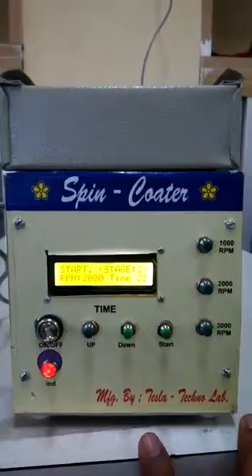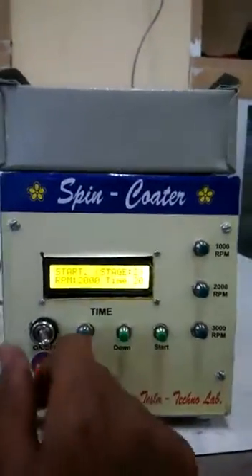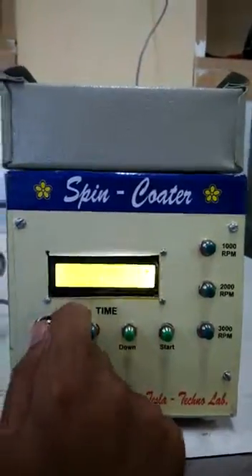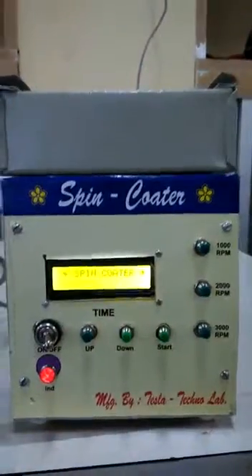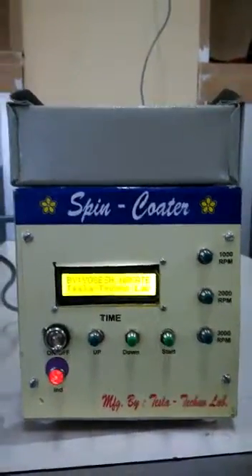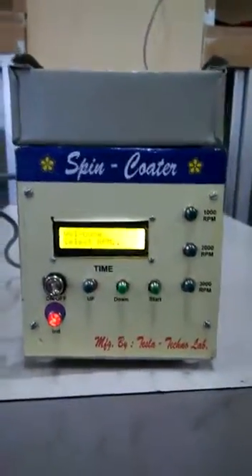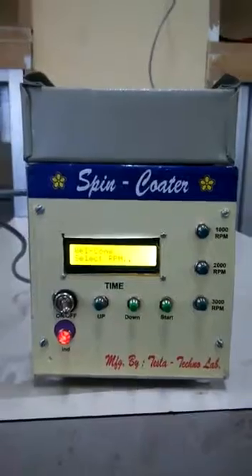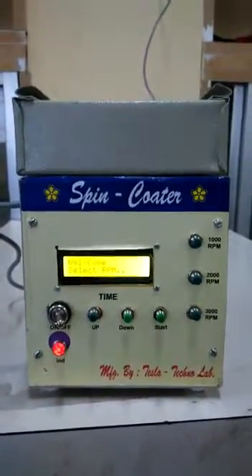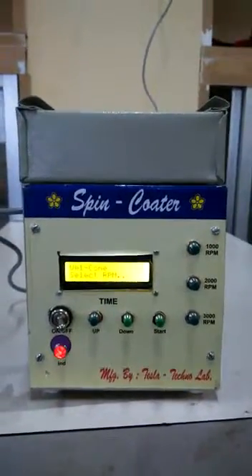When you want to change the RPM, just reset the circuit. That's it — a simple, small, and very useful research lab equipment designed by Tesla Techno Lab. Thank you.